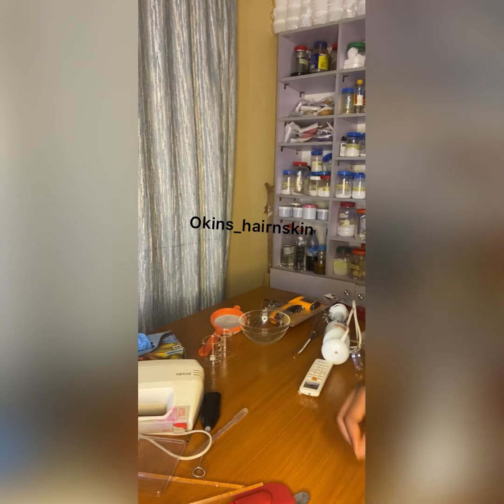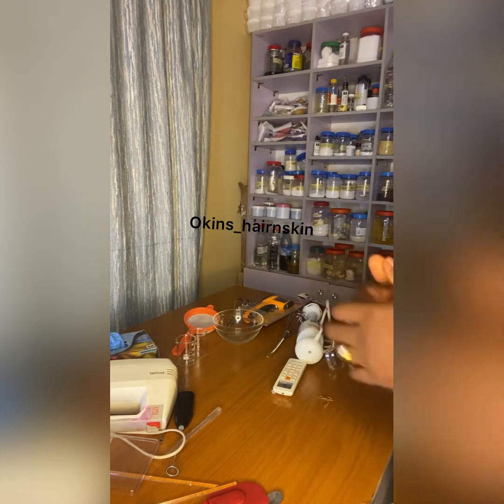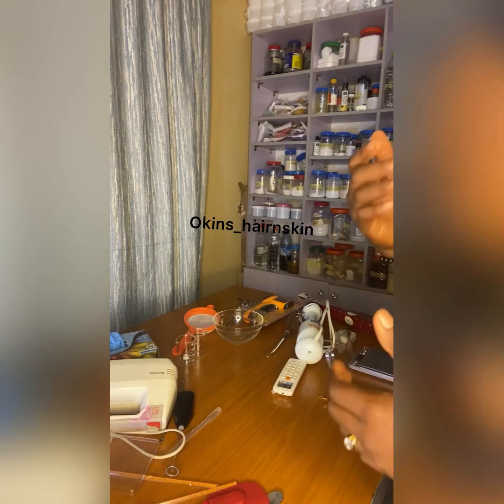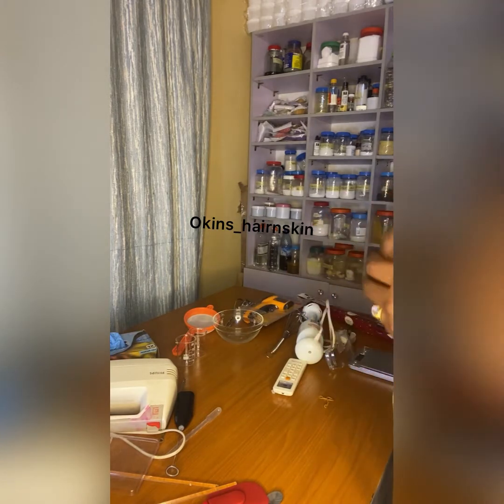Every aqueous solution, every product containing water, must have its pH checked. If you're formulating a body cream, depending on the body cream you are formulating, you have to make sure it's not below 3.5, and depending on the person that is applying it.